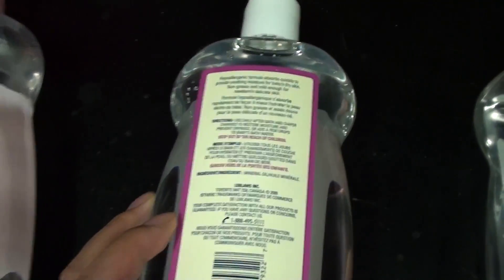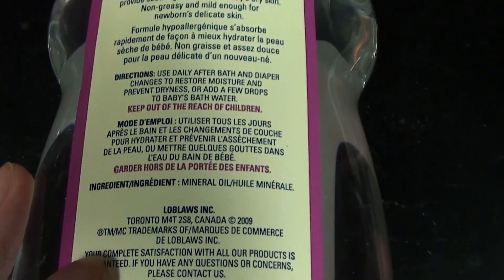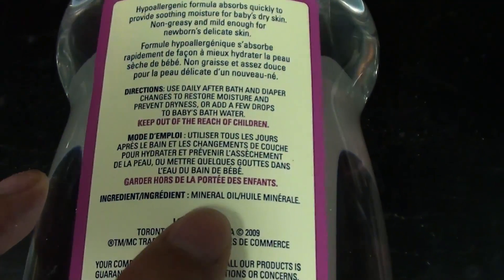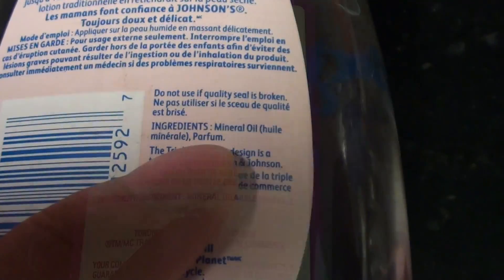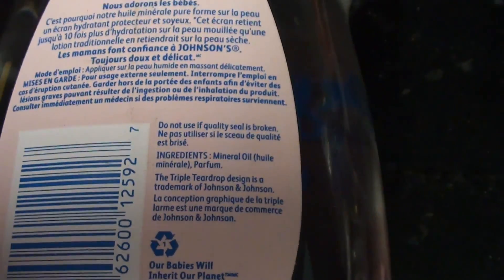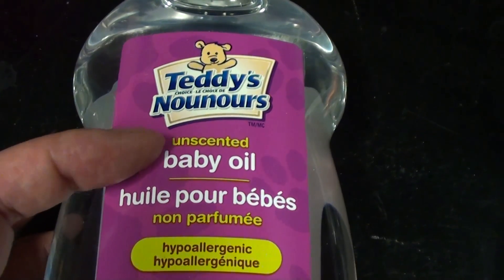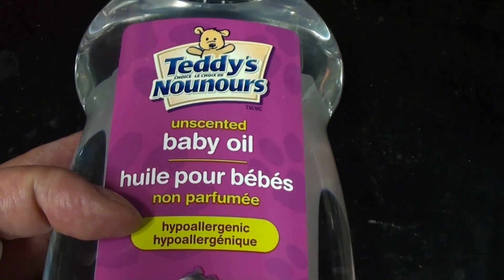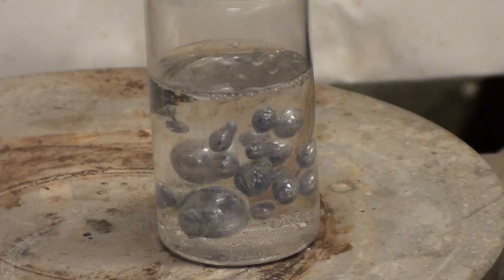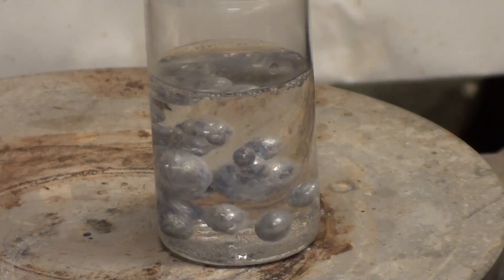When purchasing baby oil for chemistry, read the ingredients very carefully. Be sure to buy oil that's just mineral oil or paraffin oil. Often baby oil will have perfume in it which is reactive. The best oil for chemical work will say it's unscented or perfume free and is hypoallergenic. Hypoallergenic oil is low in aromatic compounds and is most inert.